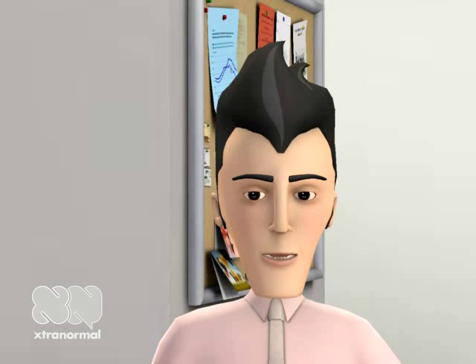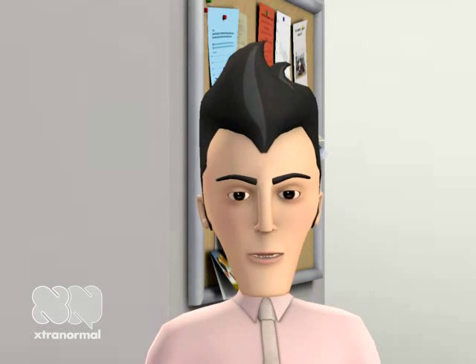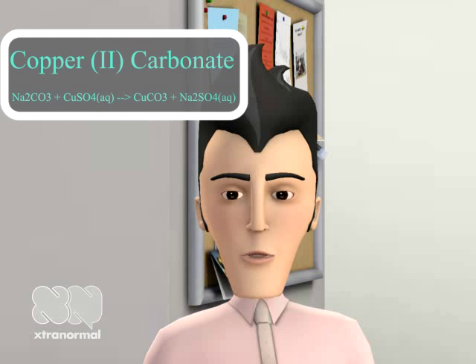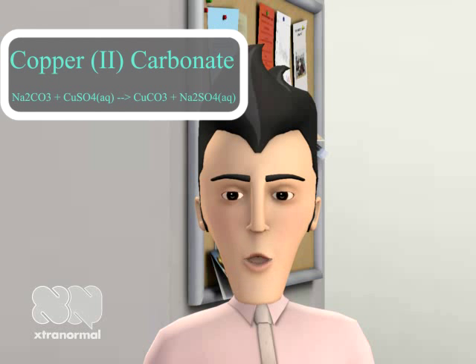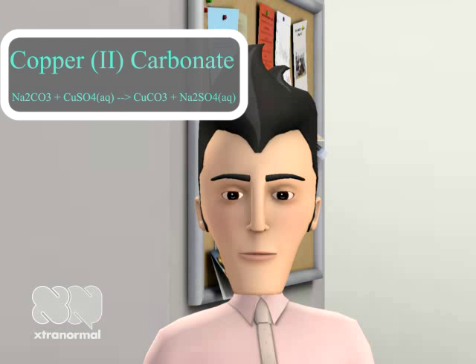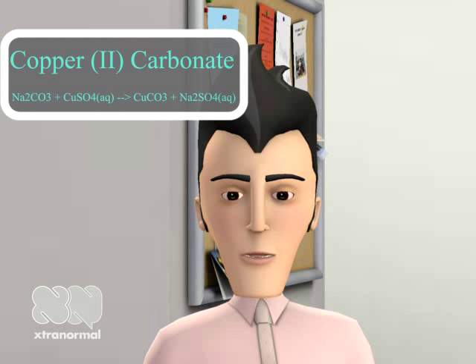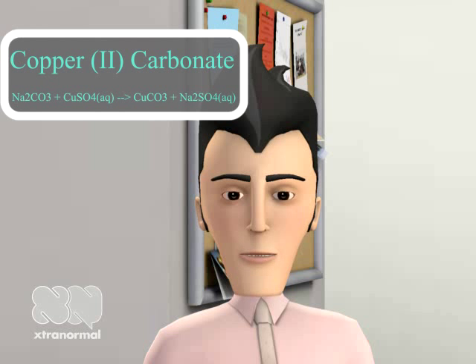To begin the synthesis, we are going to create copper carbonate by reacting copper sulfate and sodium carbonate. To do this, I'm going to hand you over to my capable assistant.